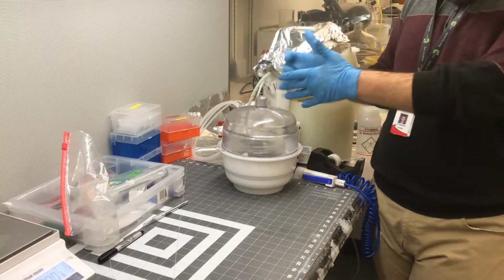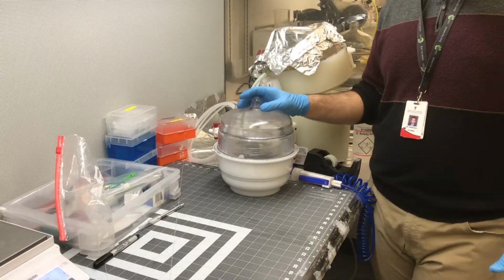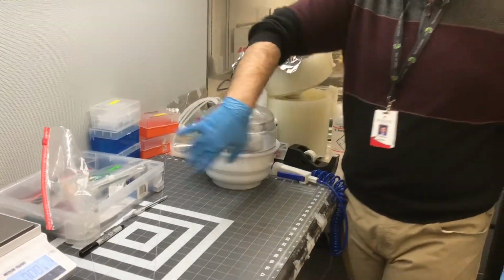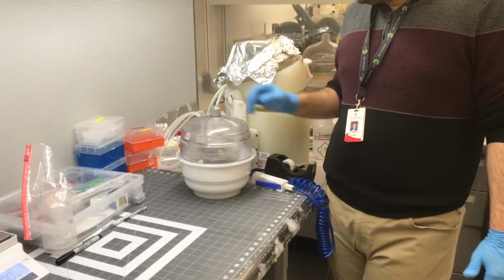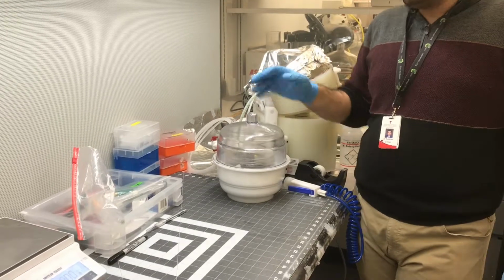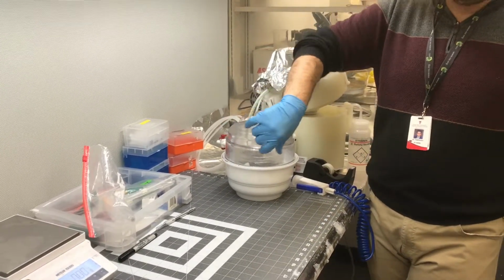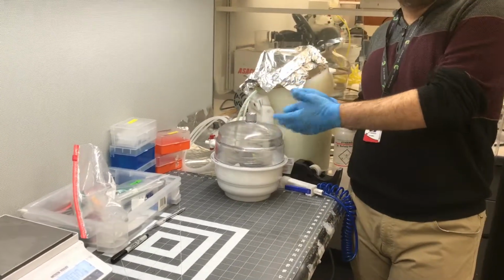Now, based on this area, the area of the chip, your master mold that you want to cover, and based on the speed that I add, it is around 10 to 15 minutes. But normally when they start, they add much slower than my speed. So for this reason, they should keep it longer.